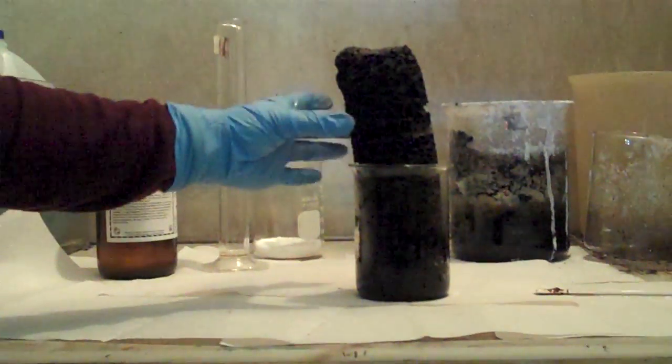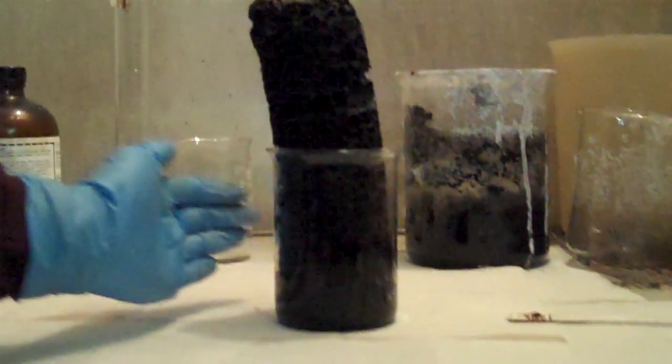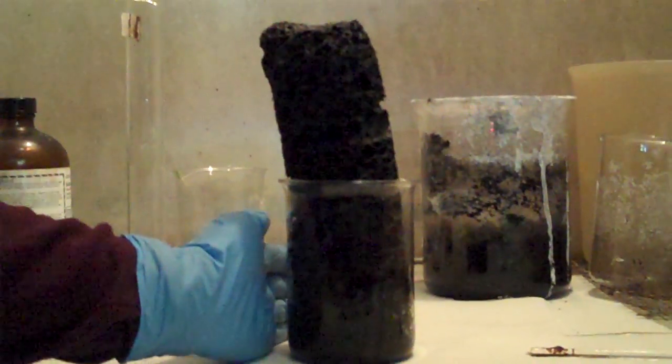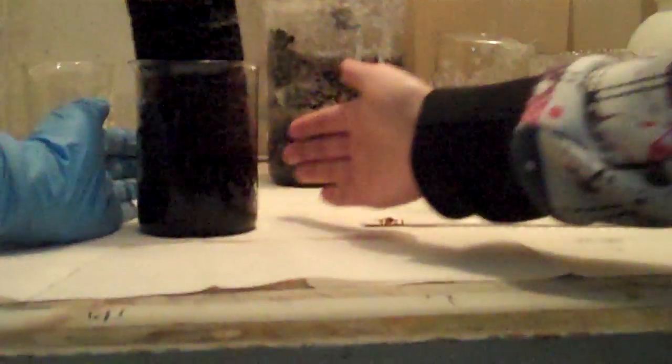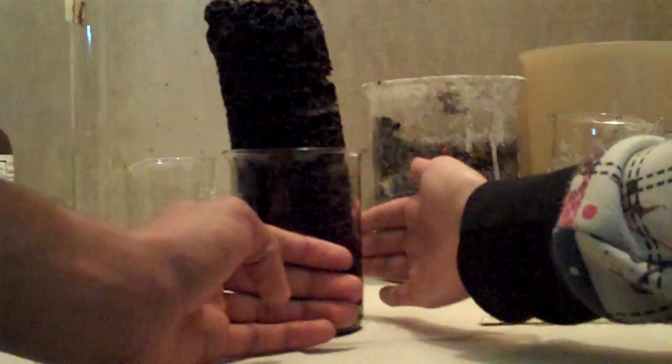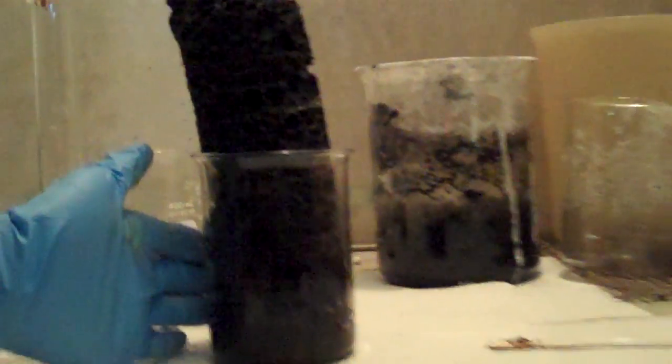Or the carbon. I can touch it with my gloves. So what happens? It's still pretty hot. Um, actually, if somebody wants to just put their hand right on the outside of the beaker. Go ahead. Just be careful. Just put your hand right against it. Don't touch it though. Can you feel that heat? Oh yeah, it's really hot. If you touch it, it'll probably burn. Because it's boiling water, right?